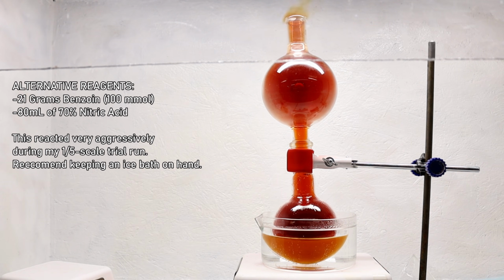For another quick side note, most procedures I've found call for using 80 milliliters of 70% nitric acid for this reaction. However, as with the benzoin, I did do a preliminary trial run of this reaction and found that using 70% was a bit aggressive for my liking. Using 60%, however, produced virtually the same yield while eliminating the risk of a runaway reaction.